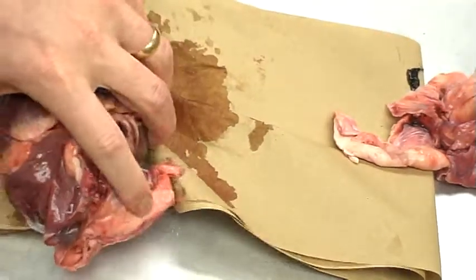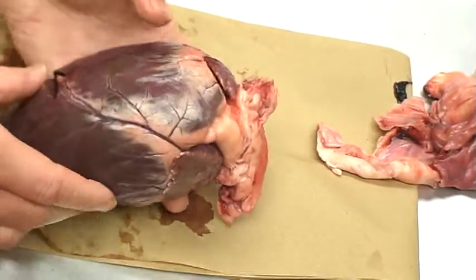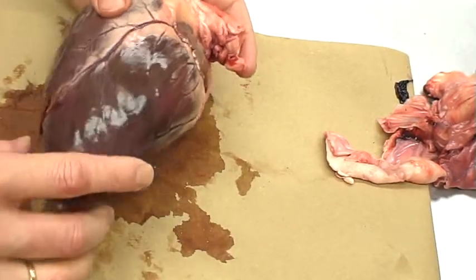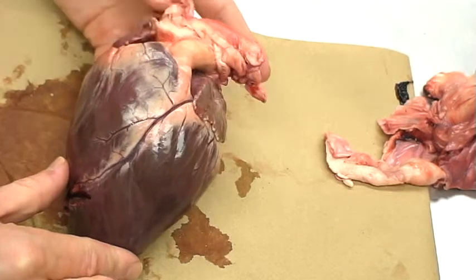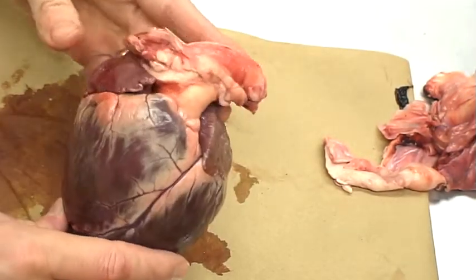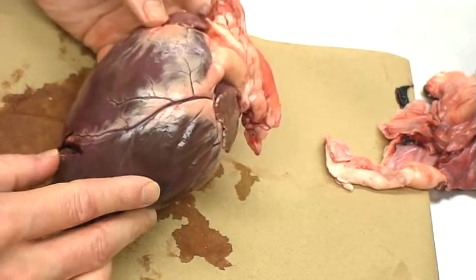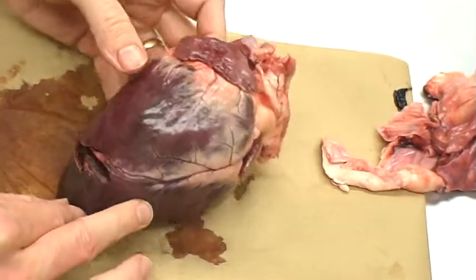Okay. Now some basic orientation. We're going to be looking at external structures of the heart. Now it's important to keep in mind, first of all, our orientation, right and left. We'll explain all these tubes and everything up above at a later time when we investigate the internal anatomy of the heart. But all I want to do is point out some external anatomy.